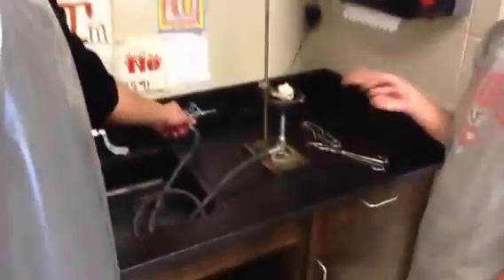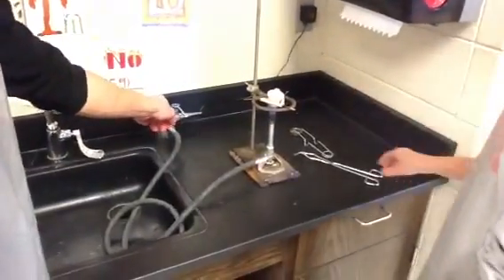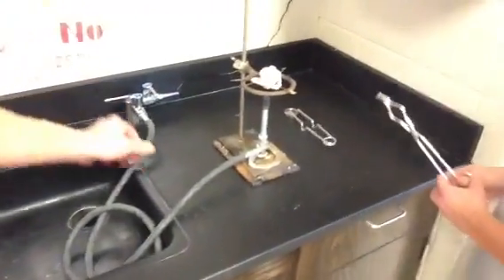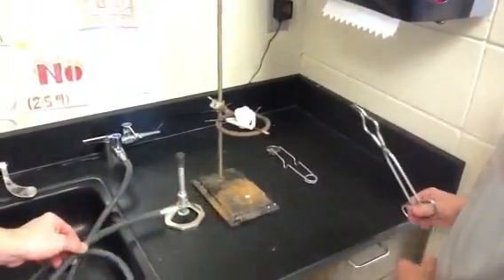And we're back after about five to ten minutes of heating. It's ready — a lot of waiting. First, we're going to turn off the Bunsen burner, because that's a hazard. The Bunsen burner is rather hot — the flame is hot. We're going to take that off.